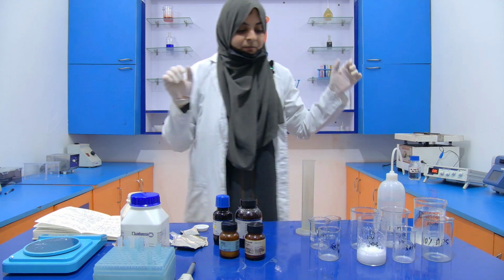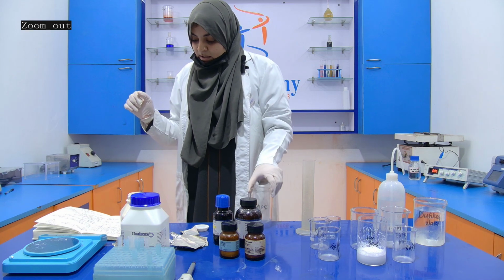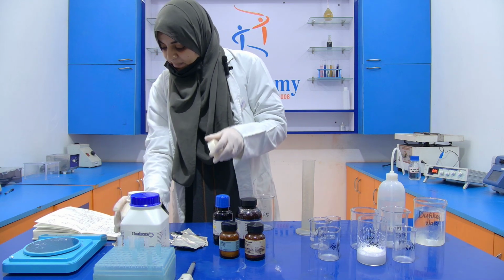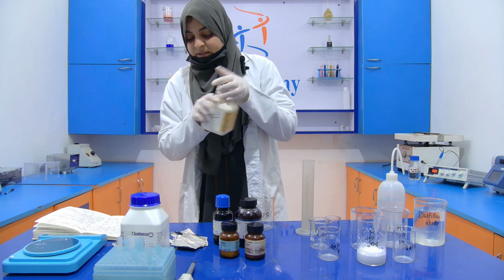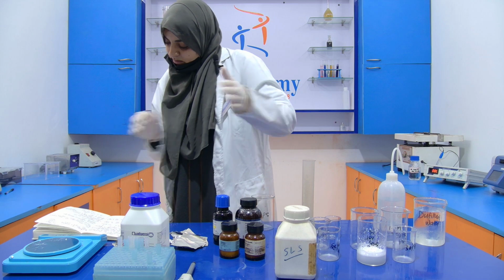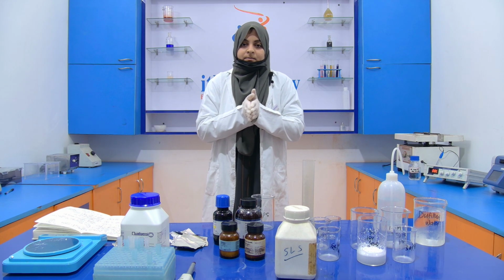Now after that, I am going to prepare 10% APS. This APS is again prepared for 0.5 ml.